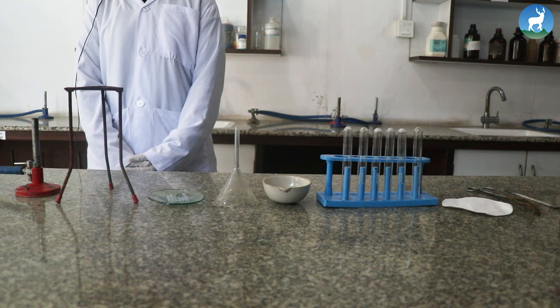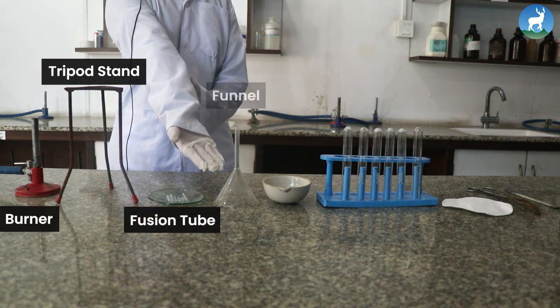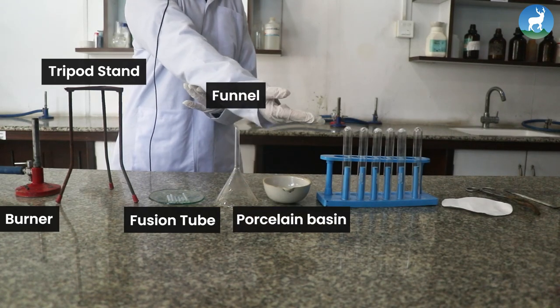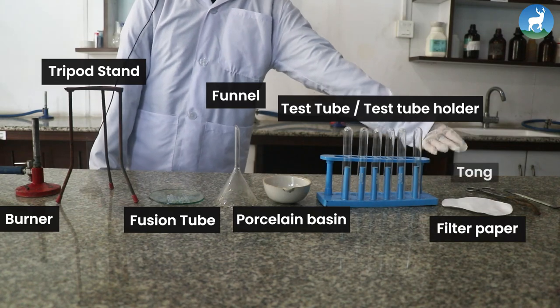The apparatus required are burner, tripod stand, fusion tube, funnel, porcelain basin, test tube, test tube holder, filter paper, tongs, and spatula.